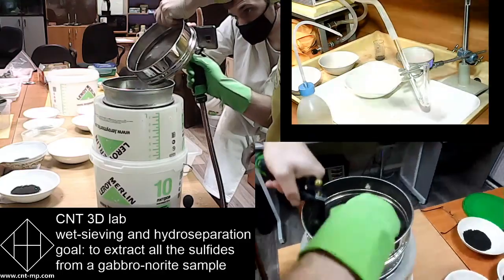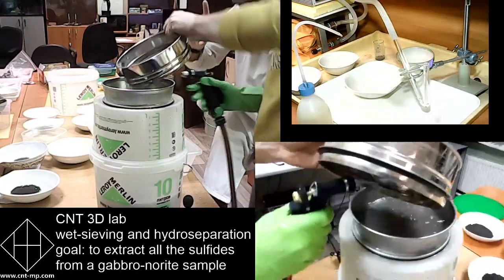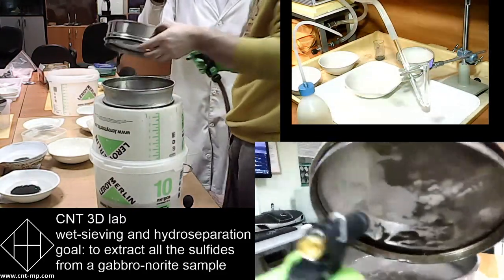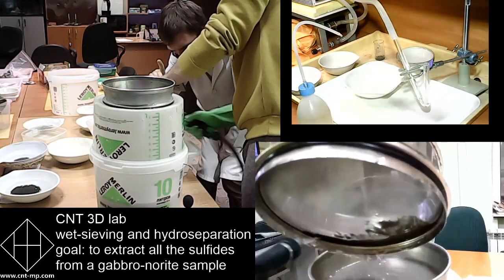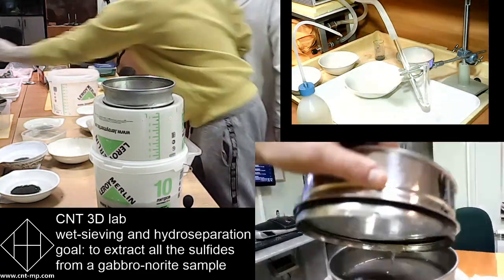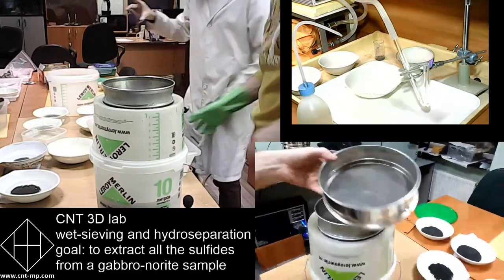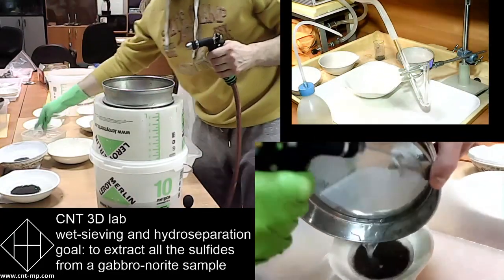But you can see that it's quick. Not a big amount of sample, but we just had that fraction to show you guys how it is done. Sometimes it has to be done several times for one sample, because here it was roughly, I don't know, maybe 200 grams. So for a big amount of sample, you have to use the same approach several times, because there's definitely not enough room for the whole amount of sample if it's bigger than 200 grams. So you have to use the same approach several times through the same set of sieves.